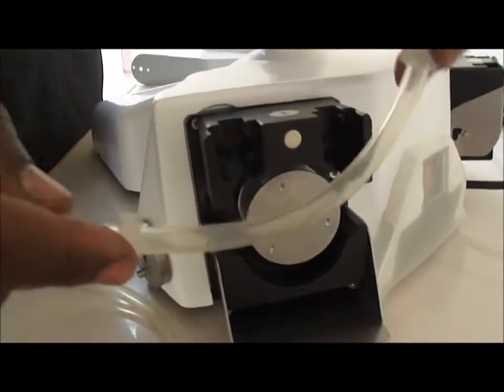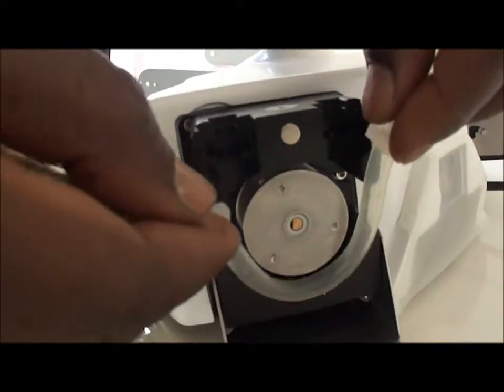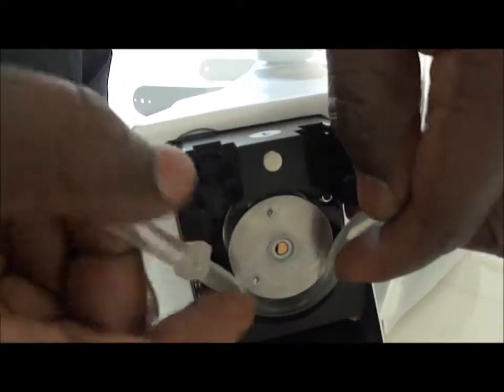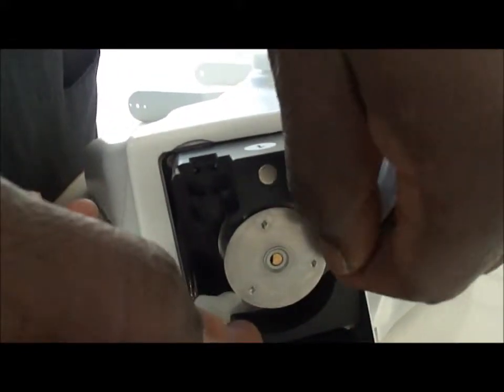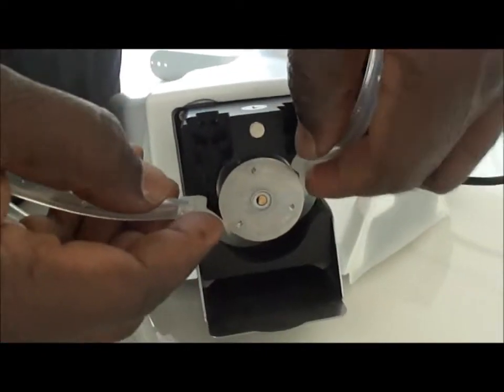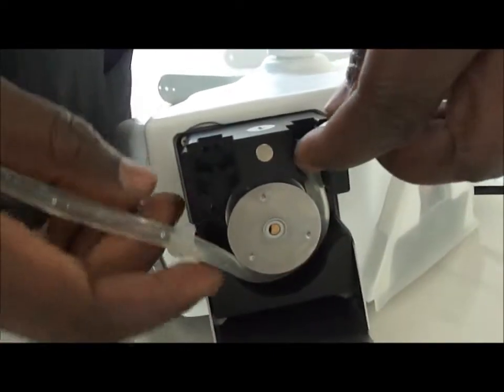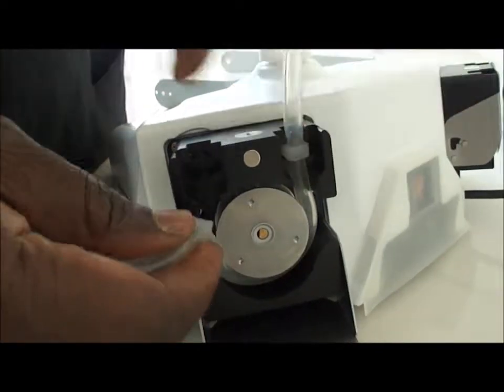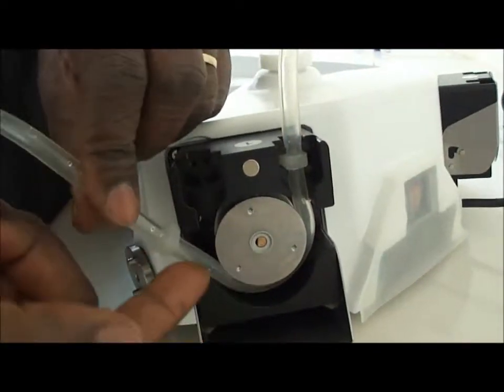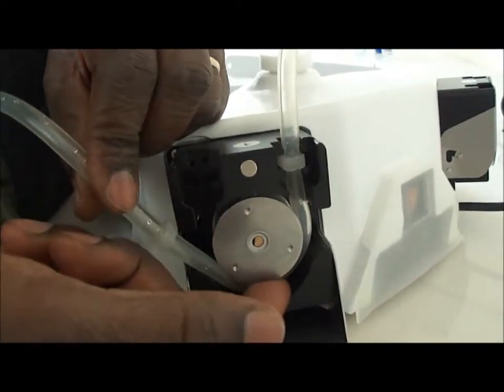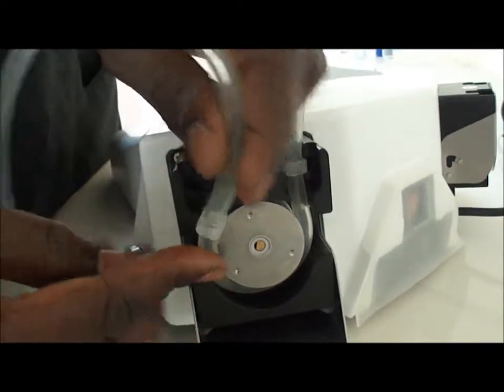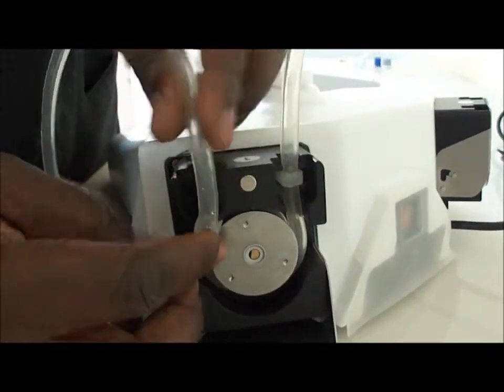I open the first pump and insert the pipe inside here making a circle, and then these plastic elements will be inserted here. One should be careful so that the pipe will not be bound here, otherwise the diluent cannot flow freely inside the pump.